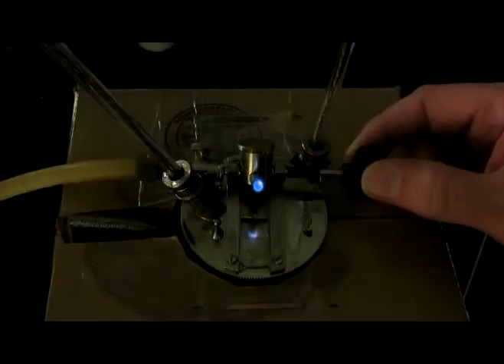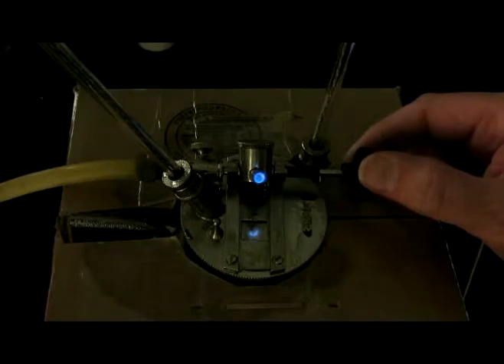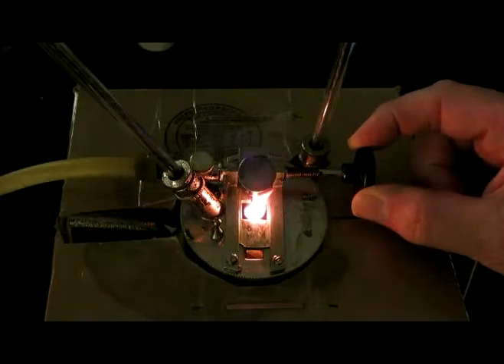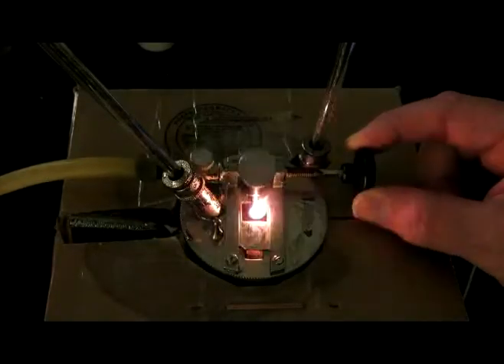Minus 9, minus 8, minus 7, minus 6, minus 5, puts the flame out.